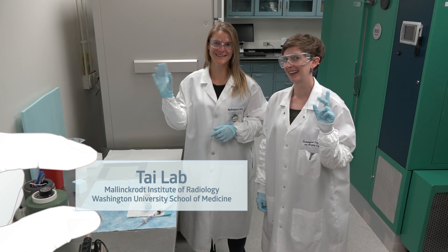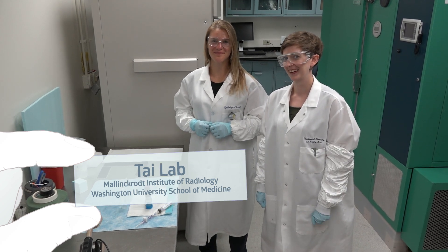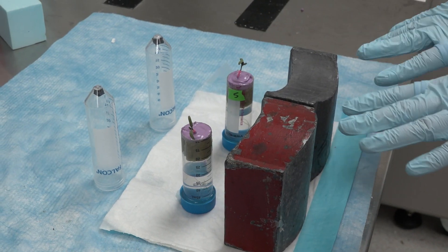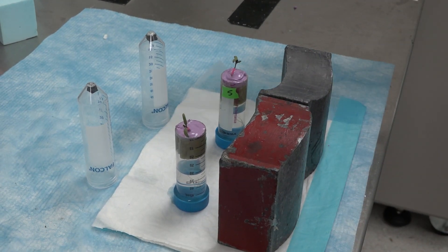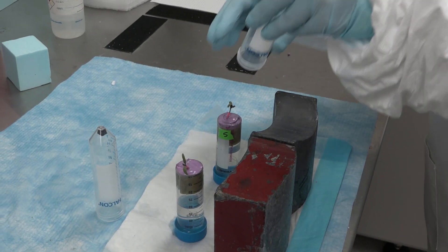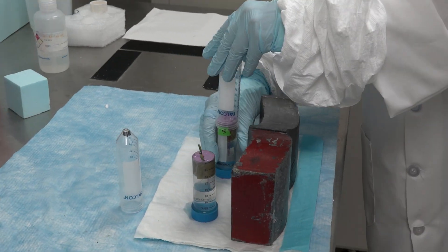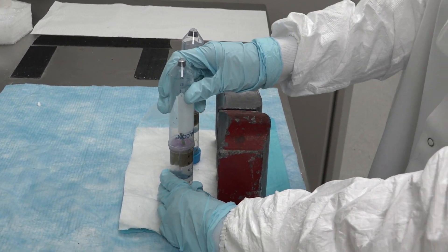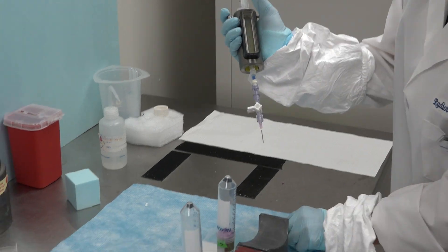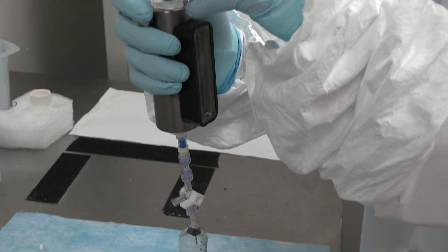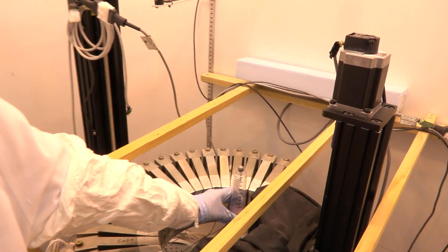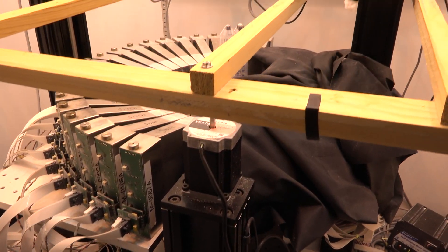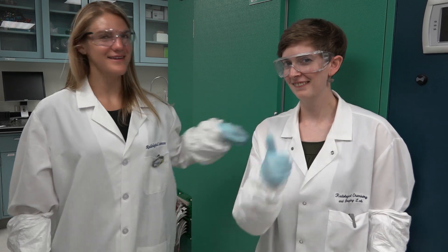We made it. And we're wearing all of this gear to protect ourselves from the radioactivity. Before we start labeling the plants, we need to put them behind these lead shields that protect ourselves from the radiation. Then we're going to seal the plants in these chambers so that we can inject the radioactive carbon dioxide from this syringe that's shielded in tungsten, and then immediately transfer the plants into the PET imager. And now the PET can do its thing, and then we can look at the results.